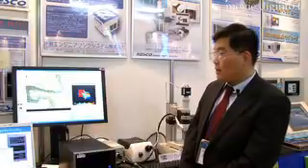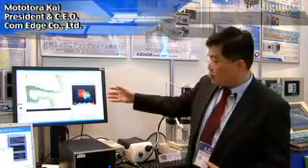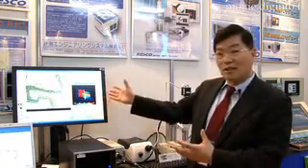Live depth synthesis and 3D processing allows for a full 3D or wireframe reproduction of the object, which can then be rotated and manipulated for a more detailed analysis. Using our special technology you can composite three-dimensional vector data into a two-dimensional image, so when a customer saves a file they can open both the 2D and 3D images.